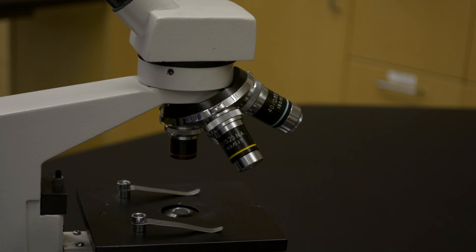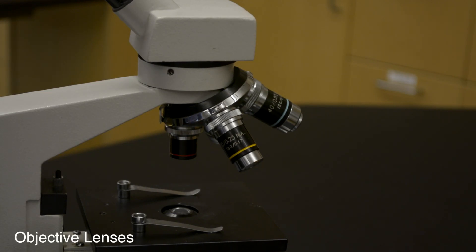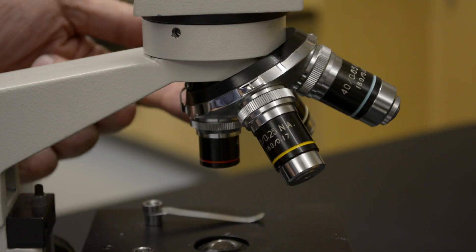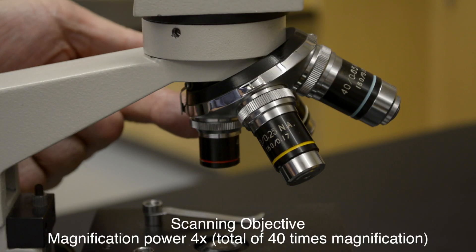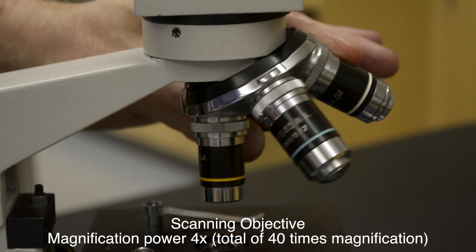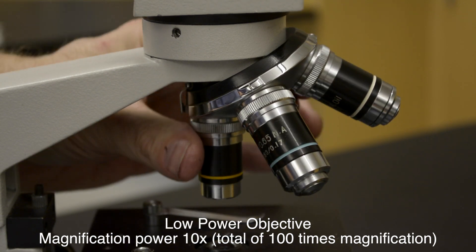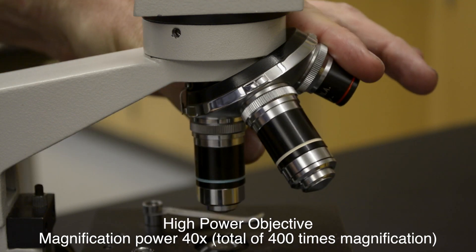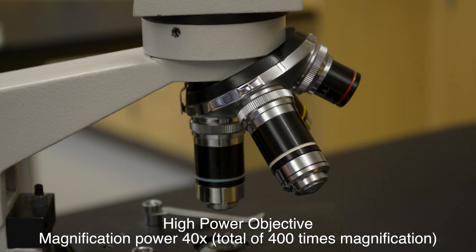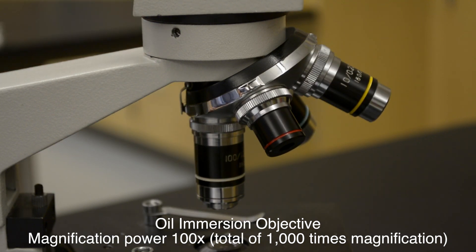The other sets of lenses found on the microscope are called objective lenses. They are a series of lenses with different magnification powers. They consist of a scanning objective with a magnification power of 4x, a low power objective with a magnification power of 10x, a high power objective with a magnification power of 40x, and an oil immersion objective with a magnification power of 100x.